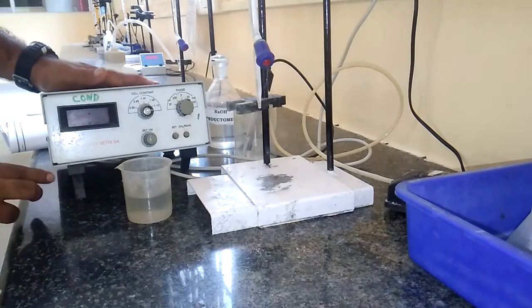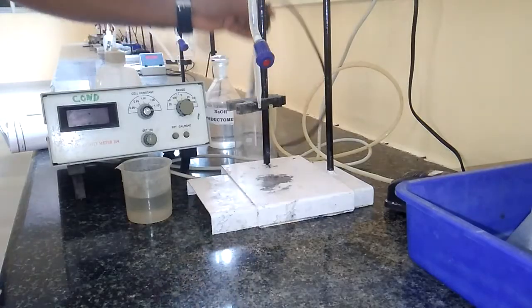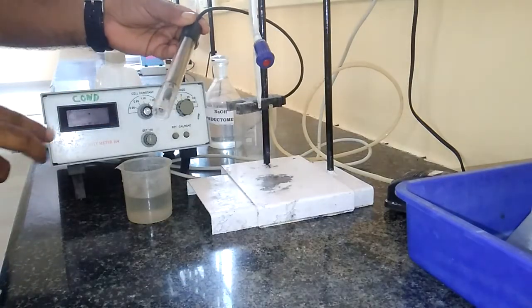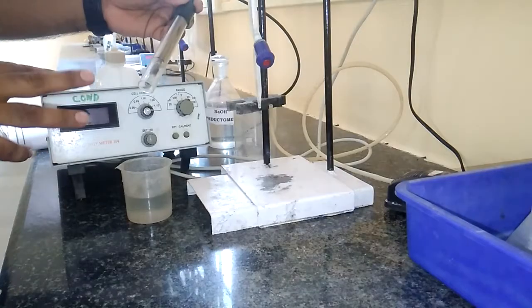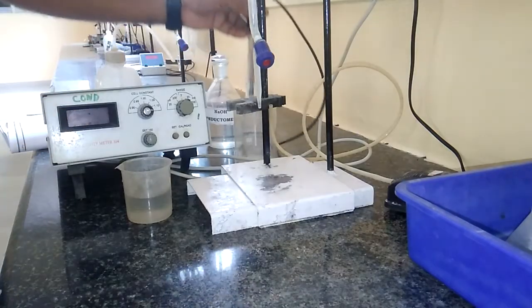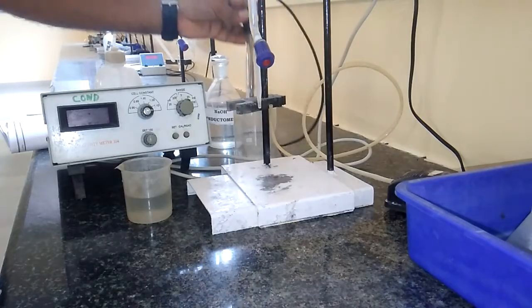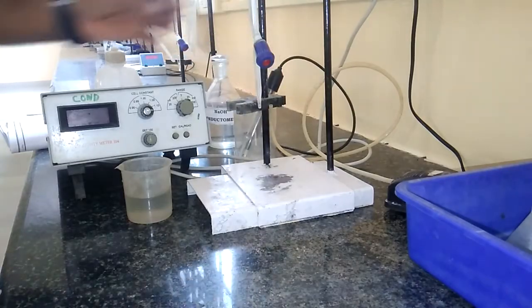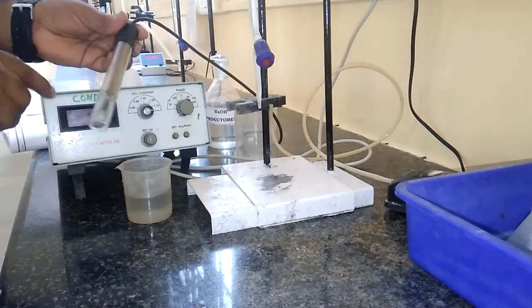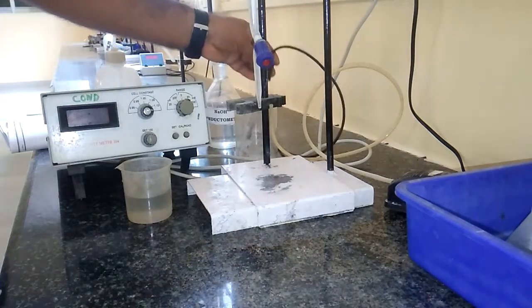This is the device instrument called digital conductivity meter. This is the conductivity cell which is made up of two platinum electrodes — both anode and cathode are made up of platinum electrodes — kept one centimeter apart having one centimeter square cross sectional area. This conductivity cell is specially designed for the estimation of specific conductance.